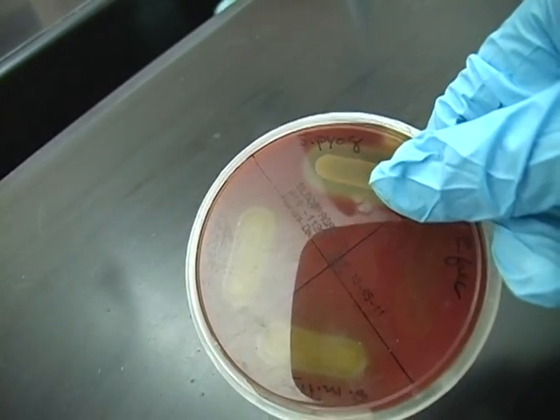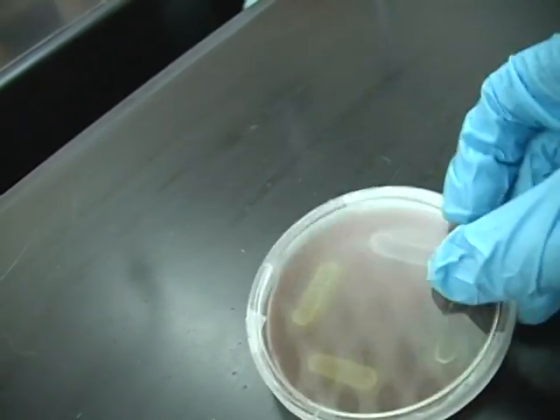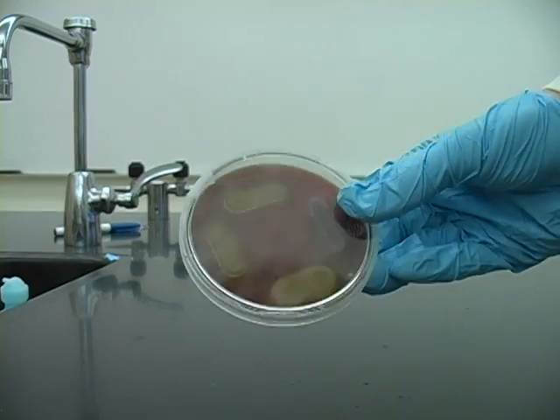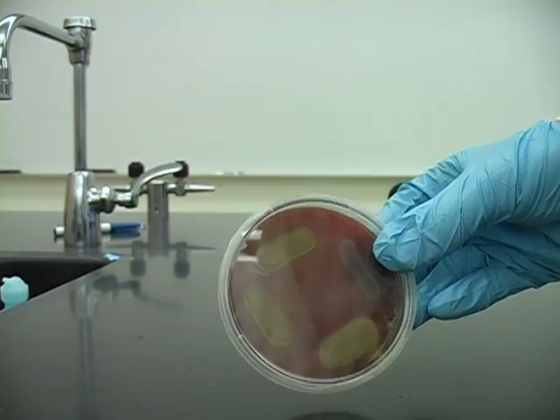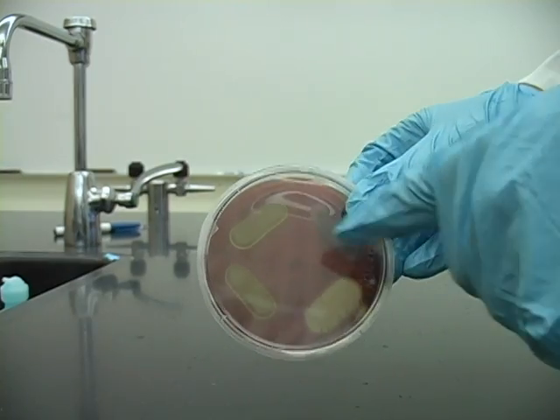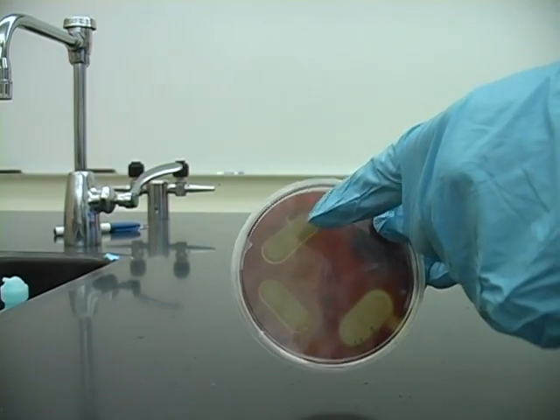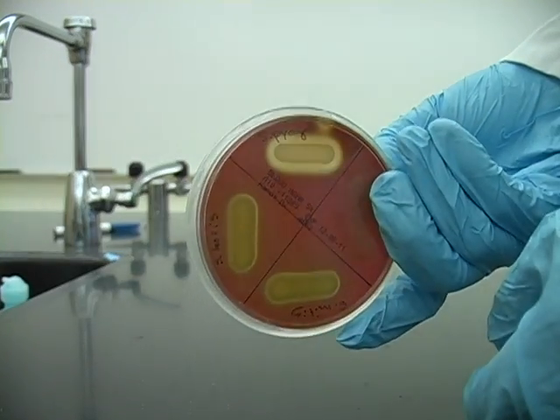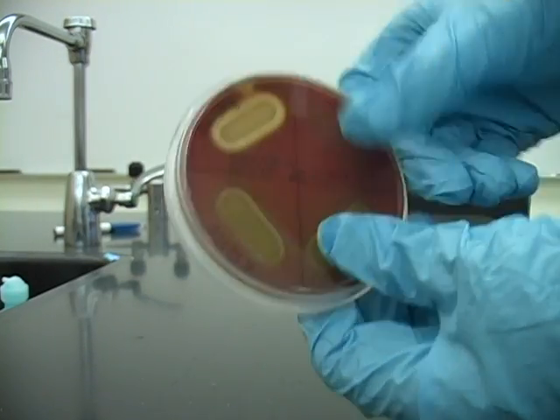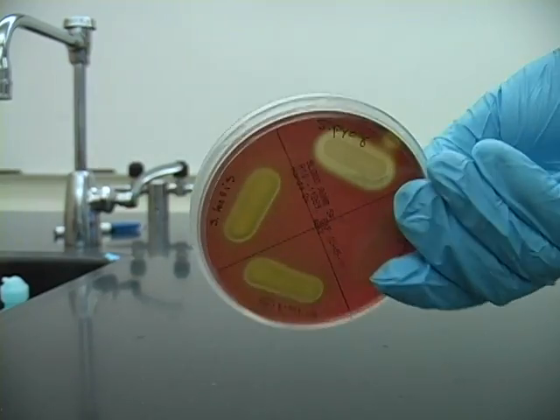There are three kinds of hemolysis: alpha, beta, and gamma. Because we're looking for changes in the media and not changes in the growths, we want to pay special attention to the areas around the growths. The cool way to do this is to flip the plate over and examine the bottom. Here you can see the differences between the top and the bottom more clearly. The bottom is easier to read because you can't see the growth.